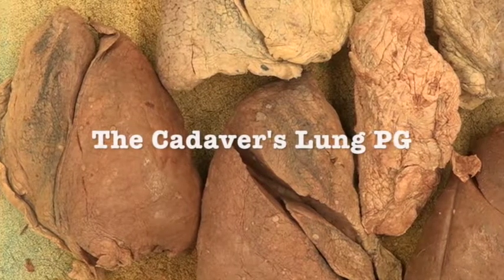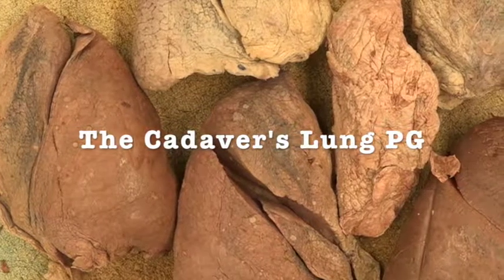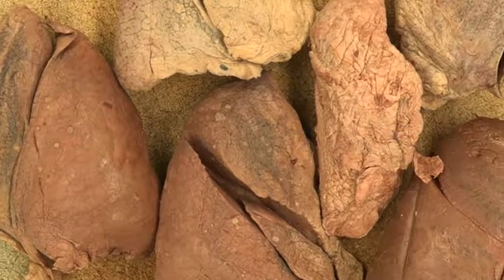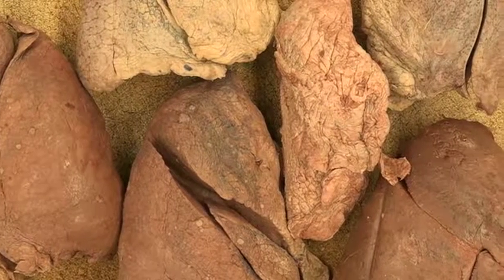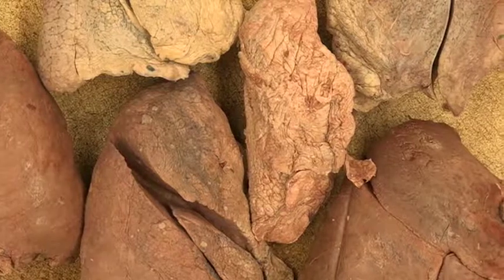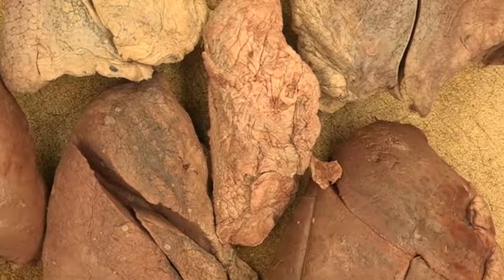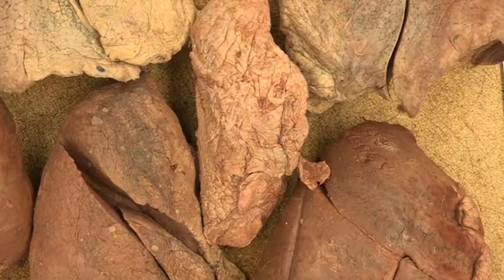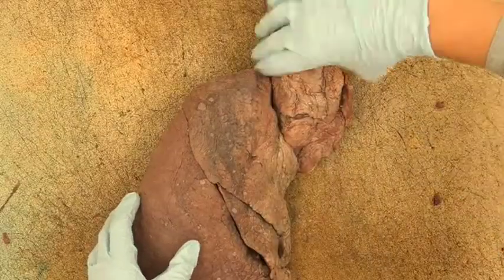This video is intended to demonstrate the steps involved in evaluating an embalmed cadaver's lung for pathology. It is intended to accompany the Cadaver's Lung PG laboratory guide. After removing the lungs from the cadaver in which you have dissected, be sure to ask your faculty whether it is okay to section the lungs before proceeding with this evaluation.